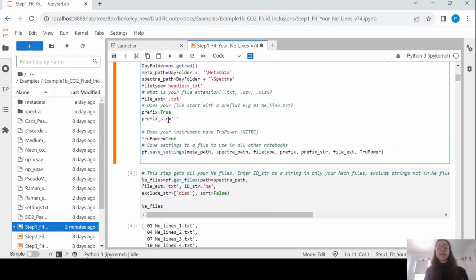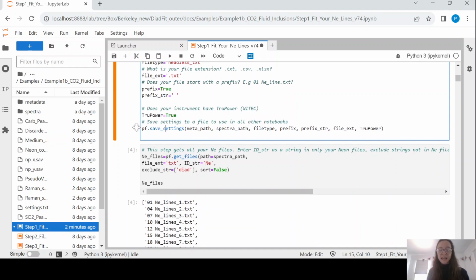And these settings are going to be used throughout these 4 steps, okay? So we're setting them all here, even though we're not using them all in this exact notebook. We're saving these in this pf save settings function. What this basically does is it makes a little settings file in here. Let's just go down a level, sorry. It makes the settings file where it has stored all of those settings, so you don't have to type them again in every single notebook.